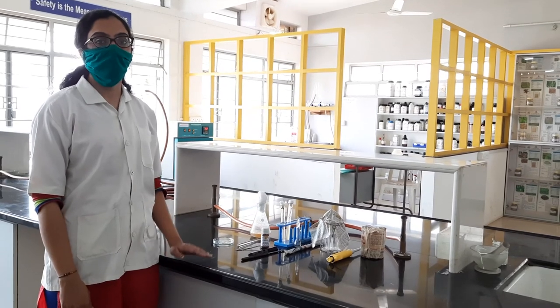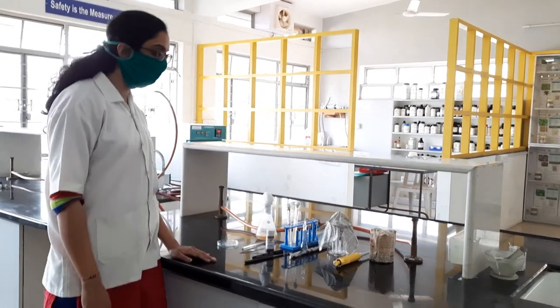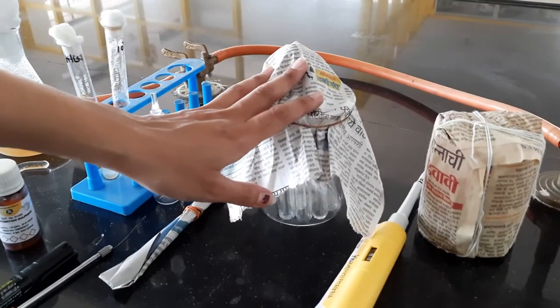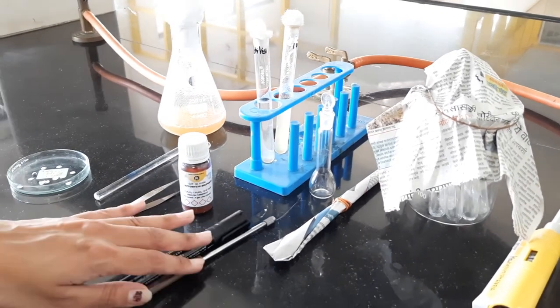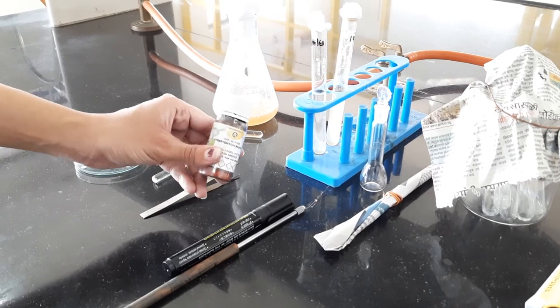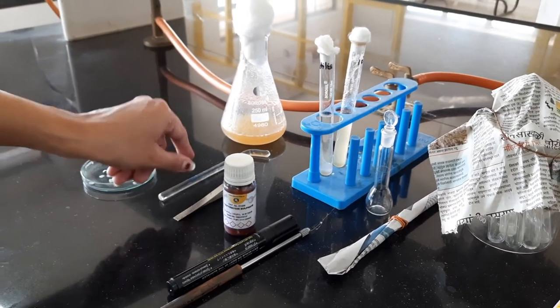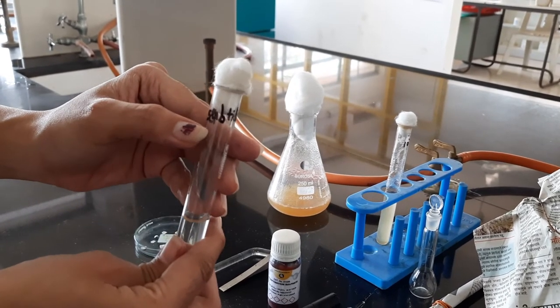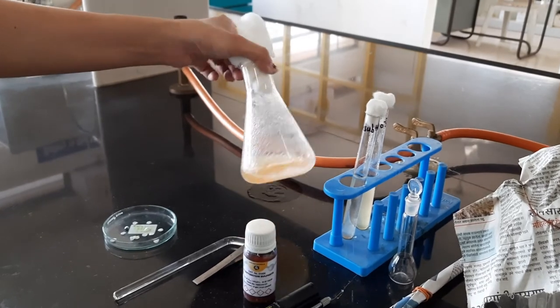Now we will see how to perform the microbiological assay by cup plate method. Requirements include: Petri plate, micropipette for preparation of dilutions, test tubes, pipette, 10 ml volumetric flask, nichrome wire loop, marker, streptomycin drug, forceps for the filter disc method, spreader for spread plate technique, bacterial sample of Bacillus subtilis as the test microorganism, and molten nutrient agar.